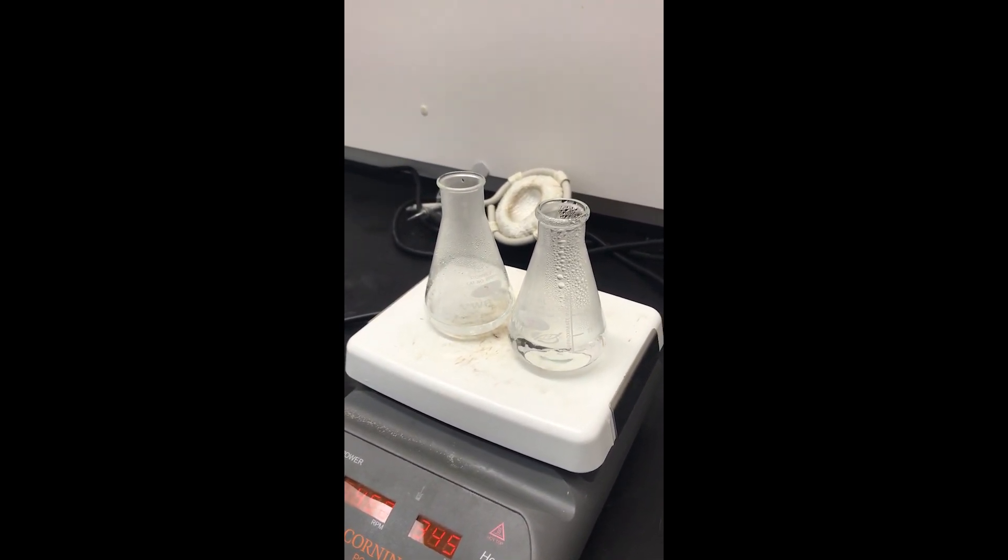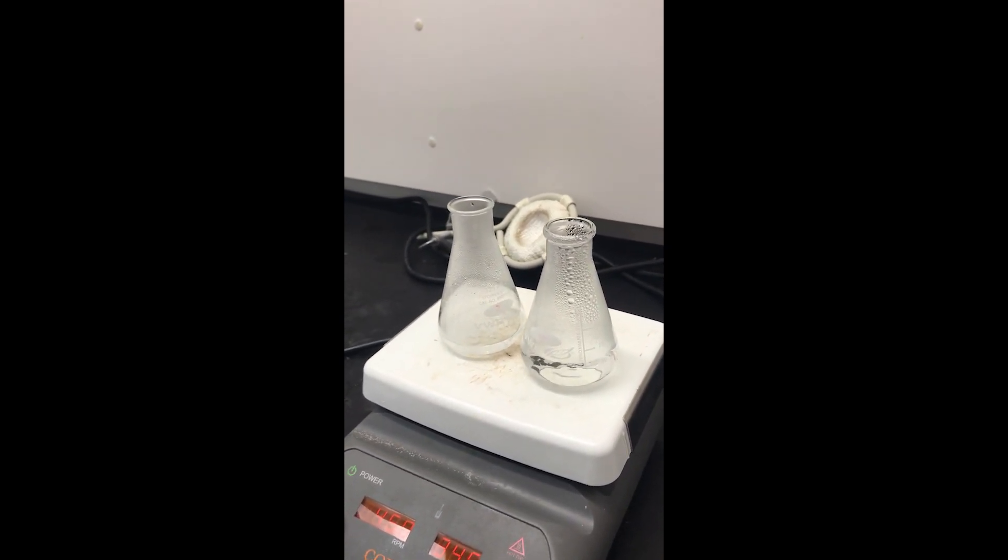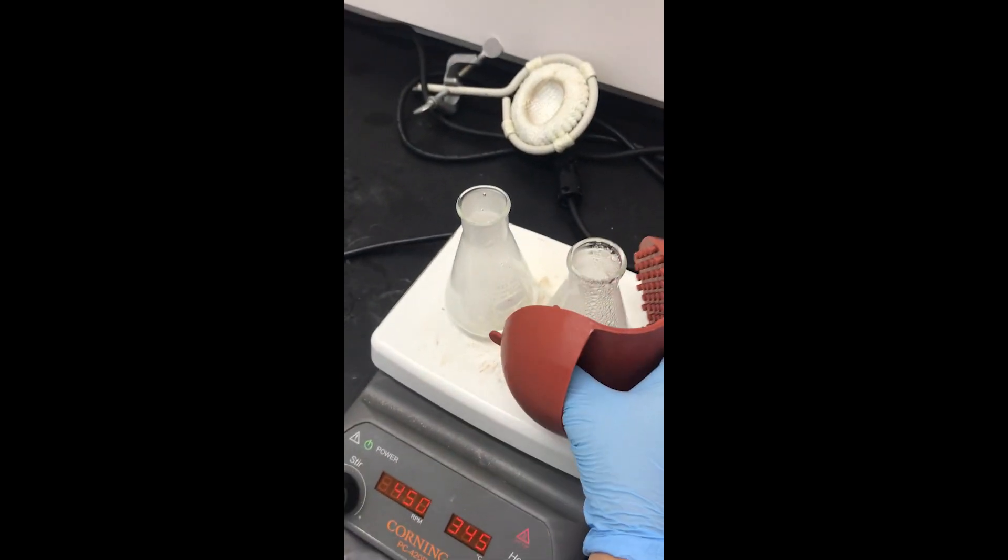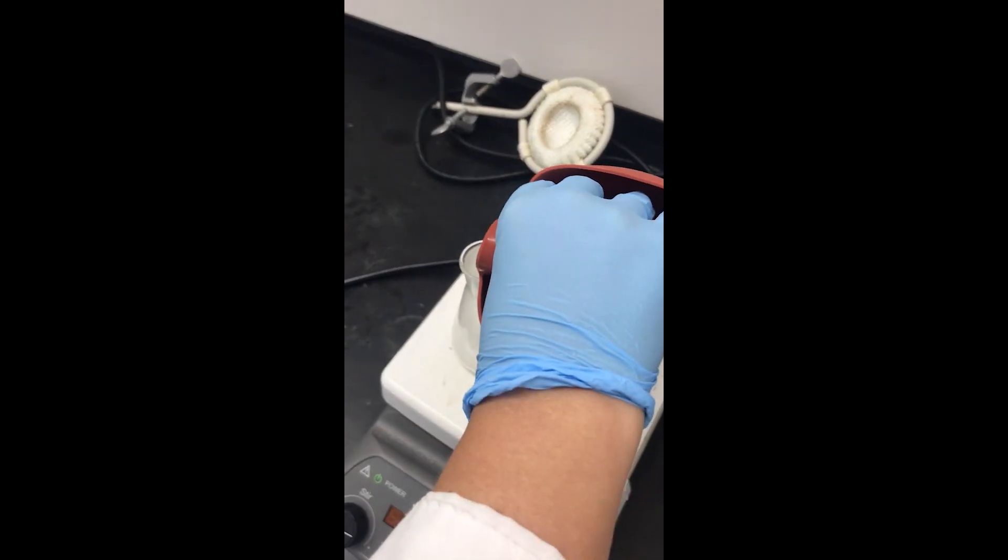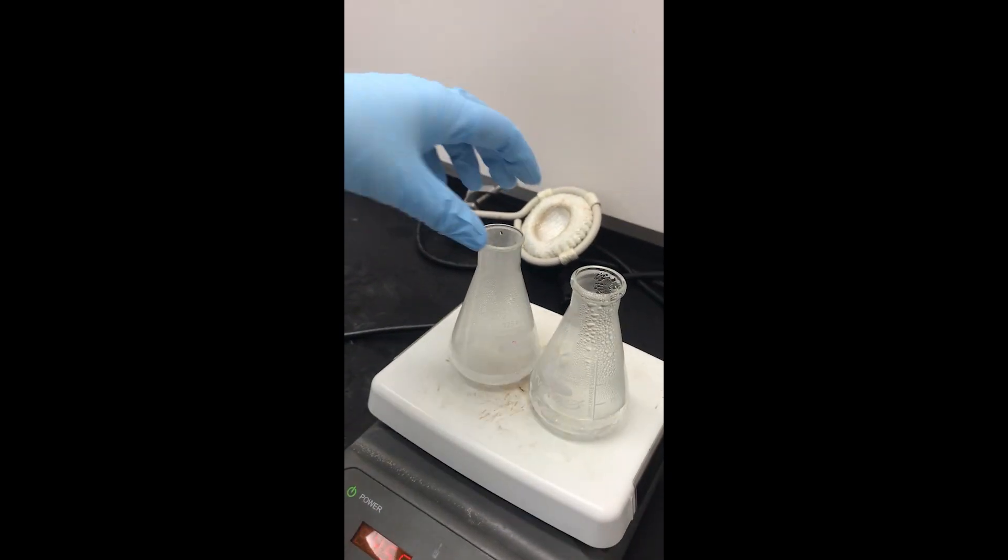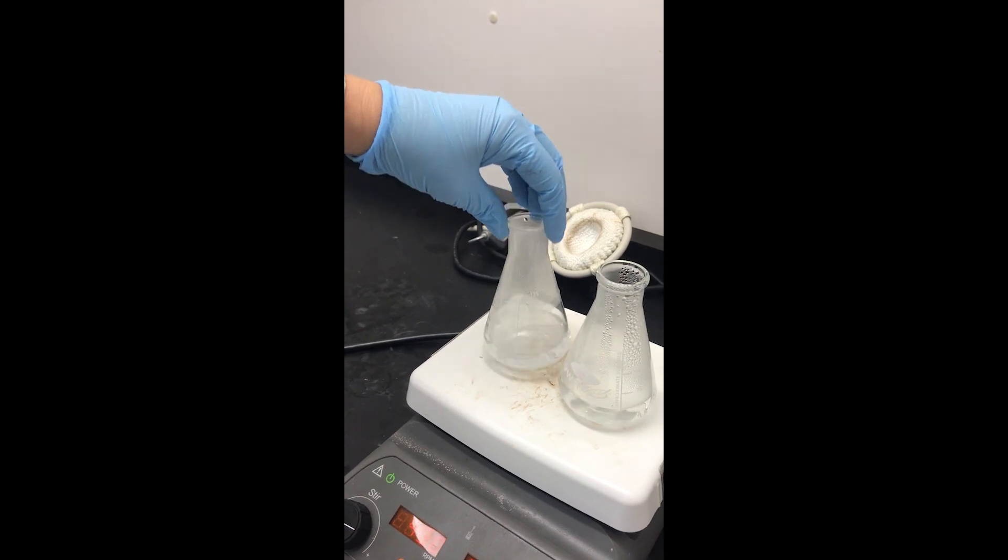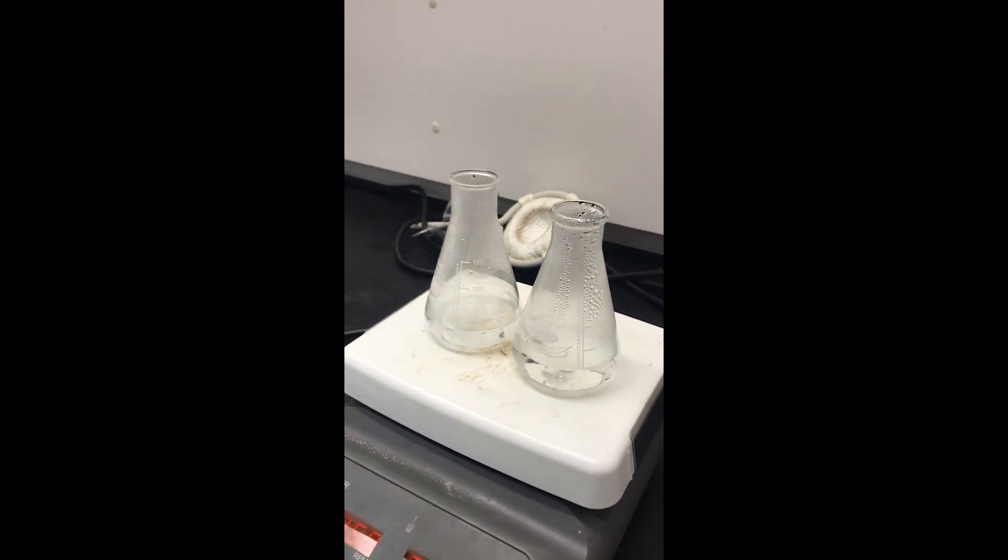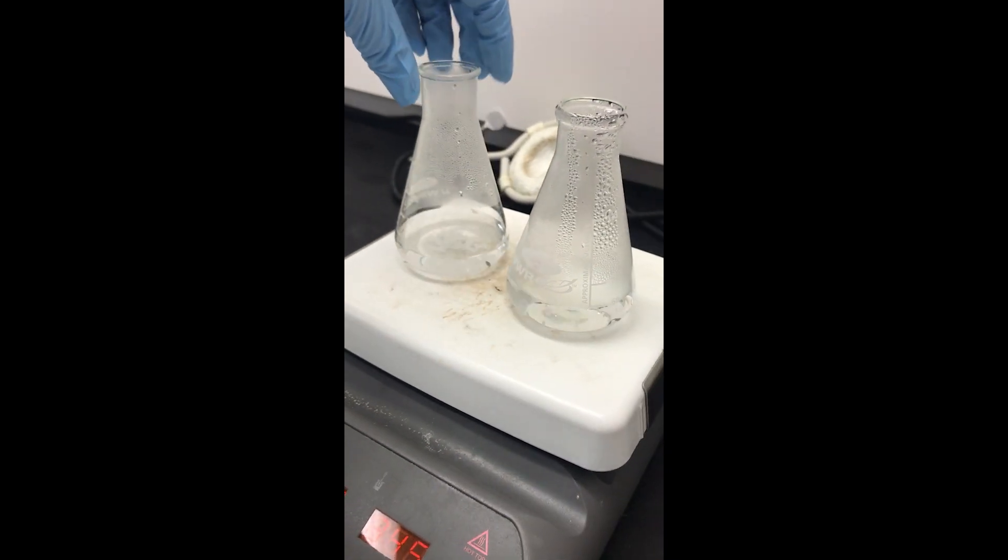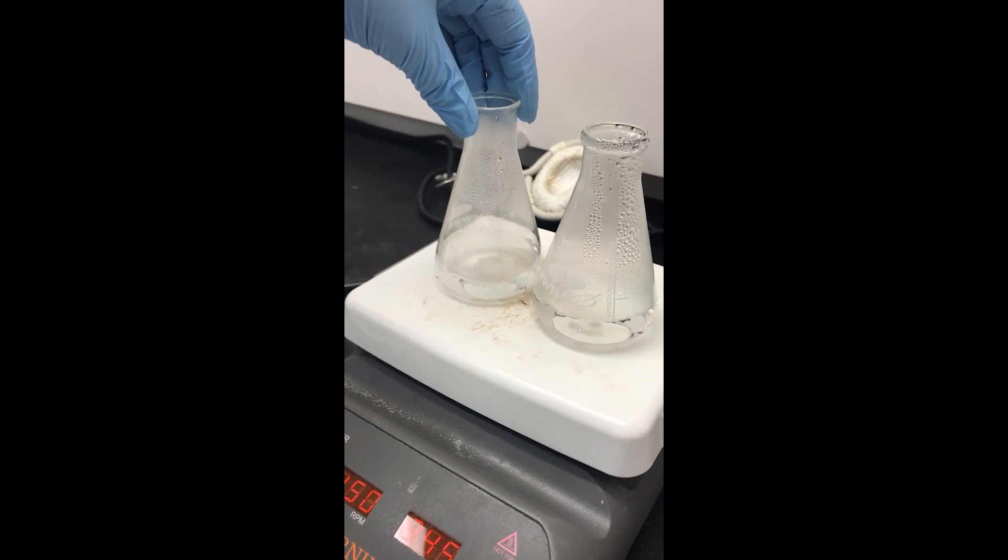If you keep adding solvent and you have the same amount of solid in there that isn't dissolving, that solid may be impurity, may not be benzoic acid.